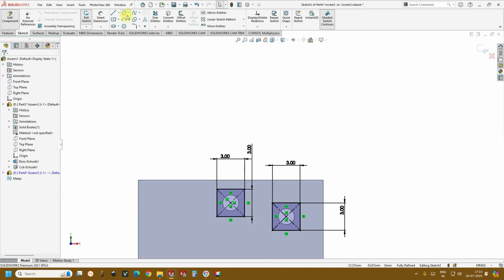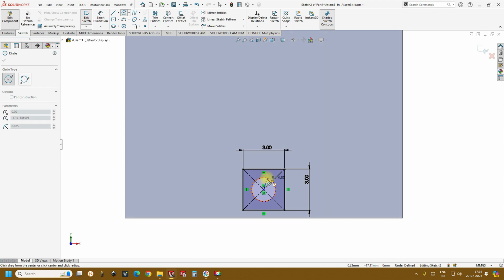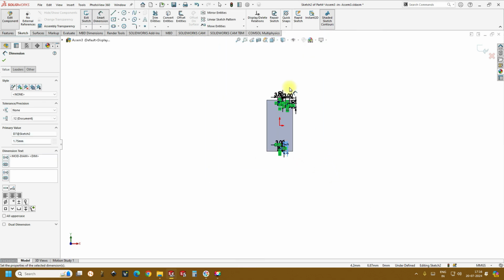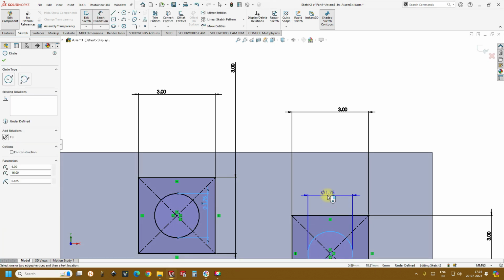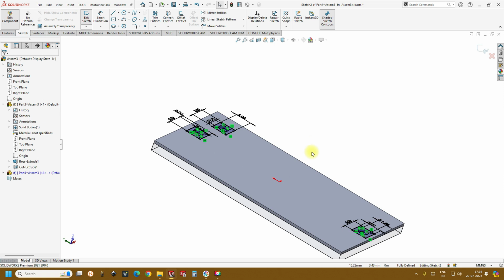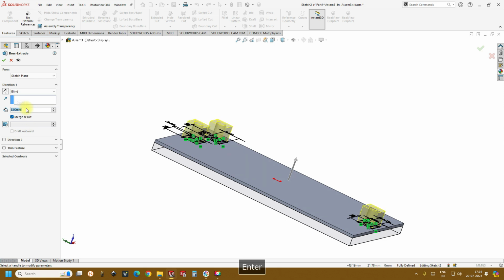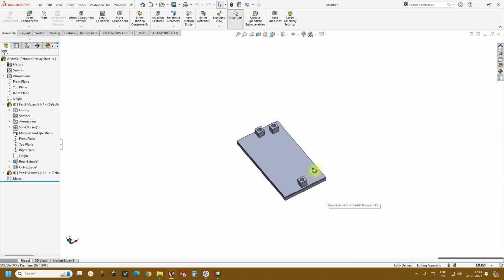Okay, now again we need a circle to create an inlet. So the square is the support and the circle is for inlet and outlet. Click OK, and then this is how it looks in the sketch. Go to features, extrude, and take it to the height of 3 mm, and this is sufficient, and exit the sketch. So this is how your complete chip looks like.